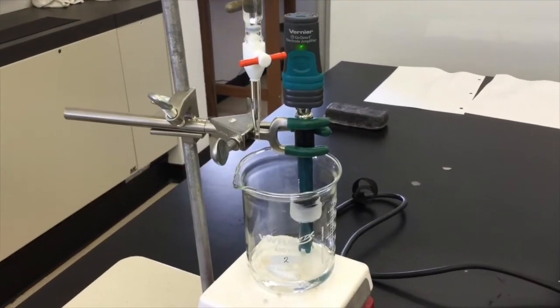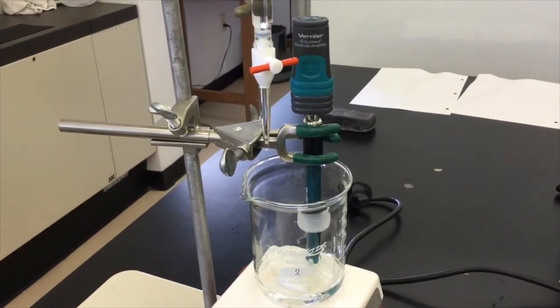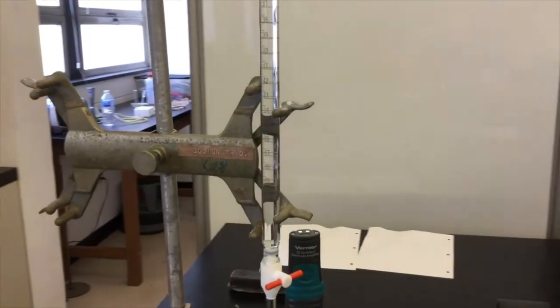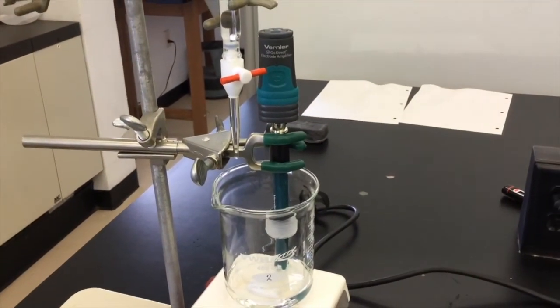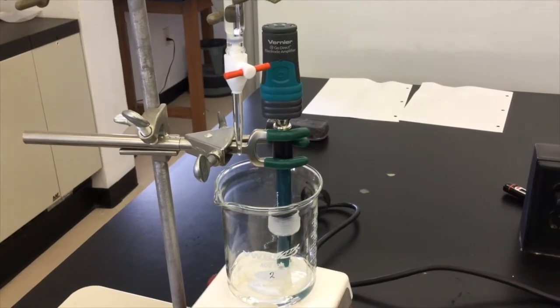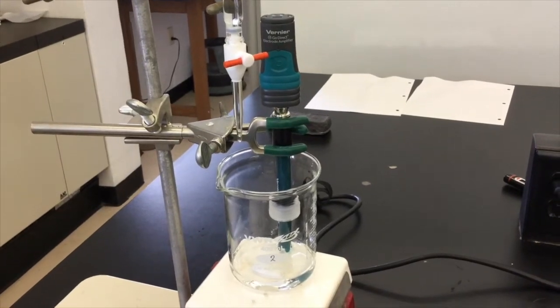This setup includes in the beaker vinegar and 20 milliliters of water plus the phenolphthalein so we can see what happens, and in the burette the same sodium hydroxide solution that we standardized during the last lab. The other device here is a pH probe, and it's going to take the pH, which is the negative log of the concentration of the hydronium ions in the solution.